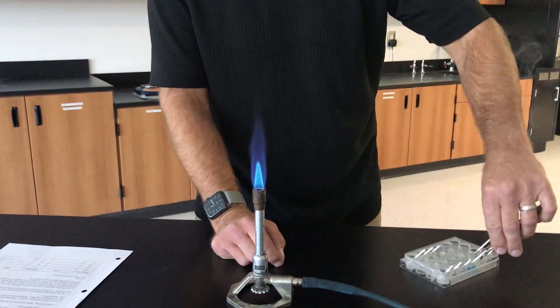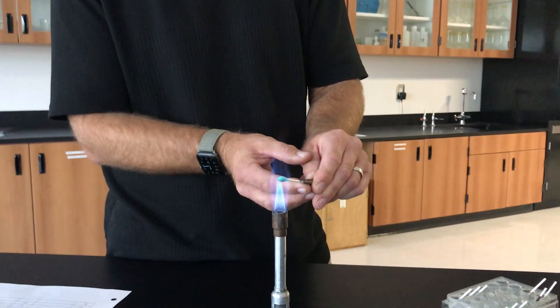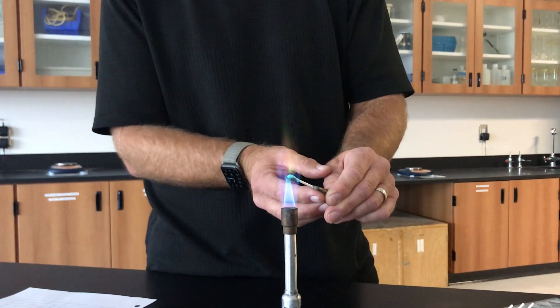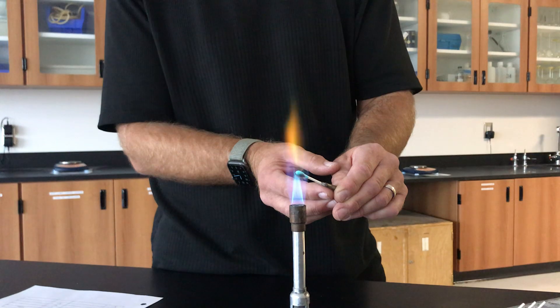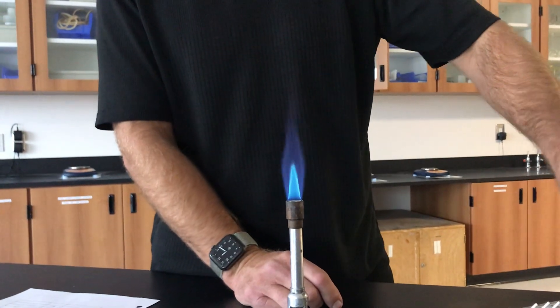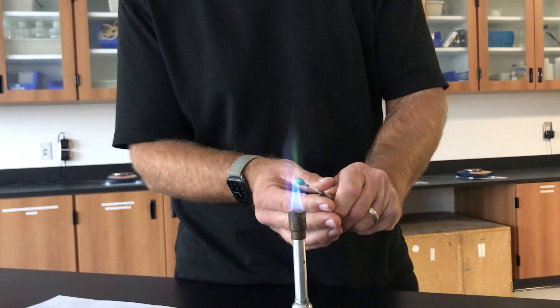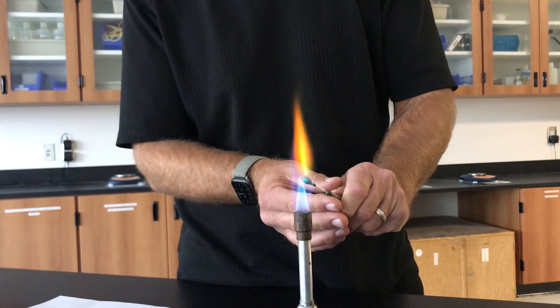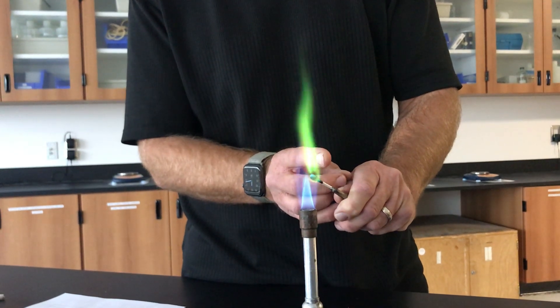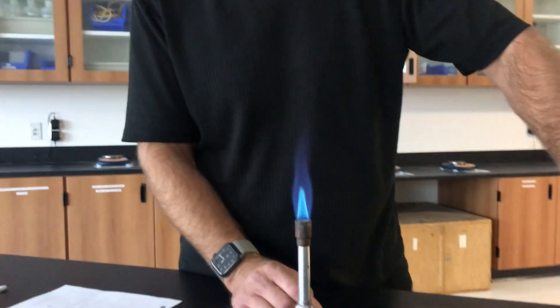Now moving on to copper. We lost the copper color in the flame of the Q-tip, so we'll come back again. This color over here on the right-hand side — there it is. That's a very vivid copper flame test color.